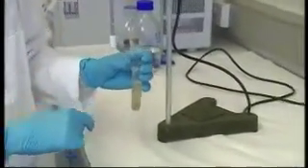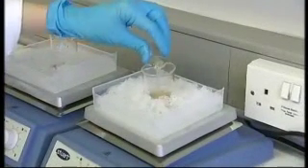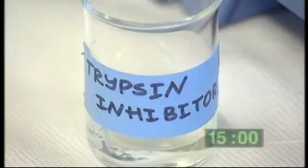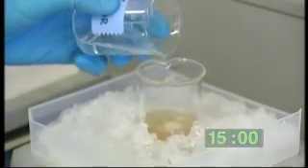After the second homogenization, on the 15th minute of incubation, add 10 ml of isolating buffer containing trypsin inhibitor and incubate for one more minute.